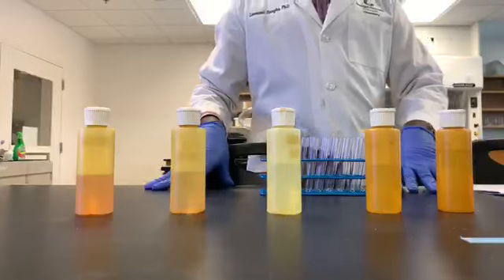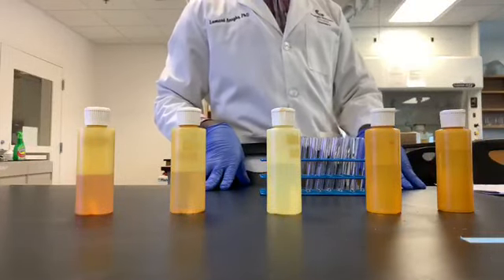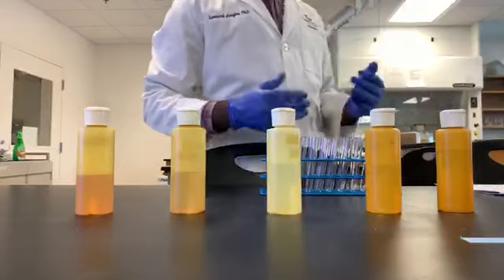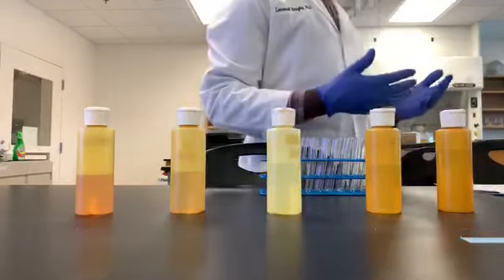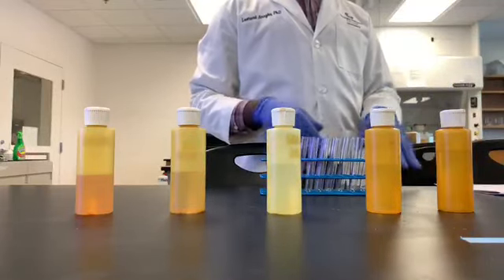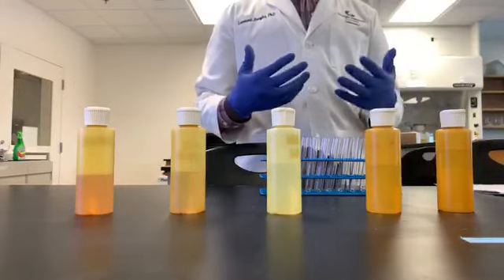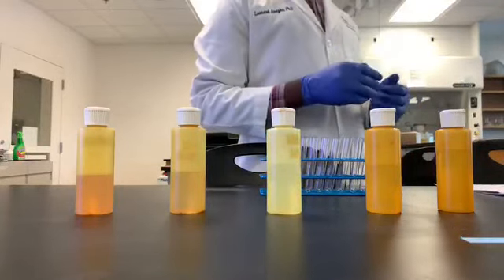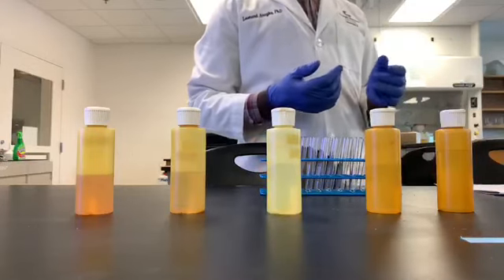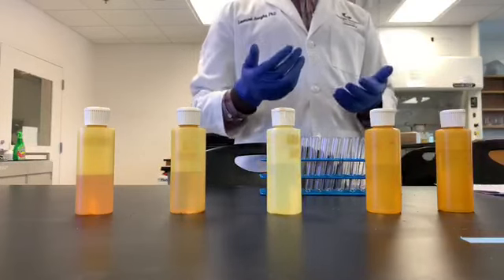All right, so in today's experiment, we're checking miscibility of liquids. What we're going to do is put two liquids or two solvents together and observe if they are miscible or immiscible. If you mix two samples and they are miscible, you will end up seeing a solution that does not have a separation in phases. If they are immiscible, you will see that separating into two layers.